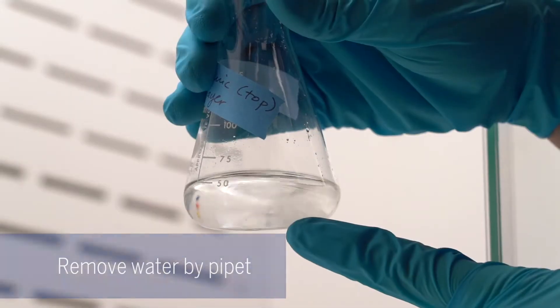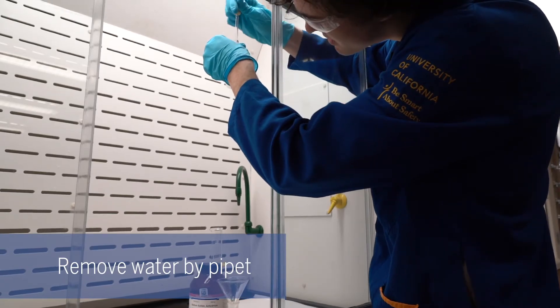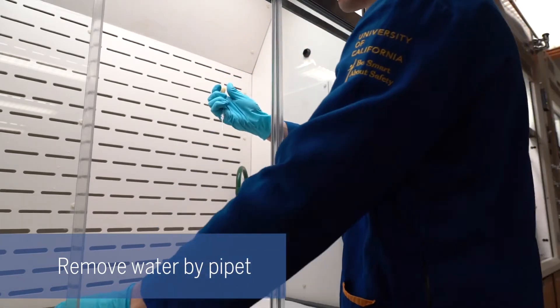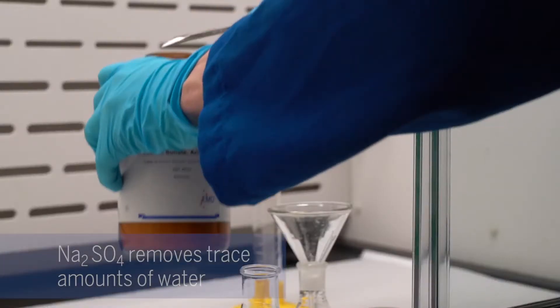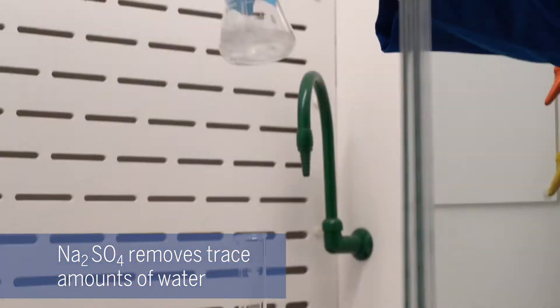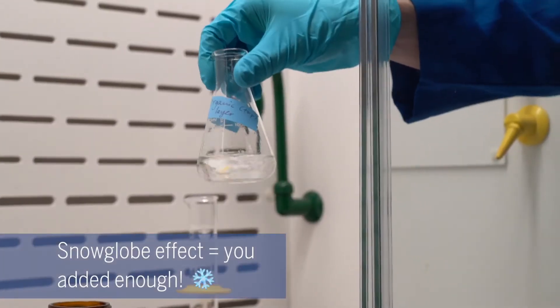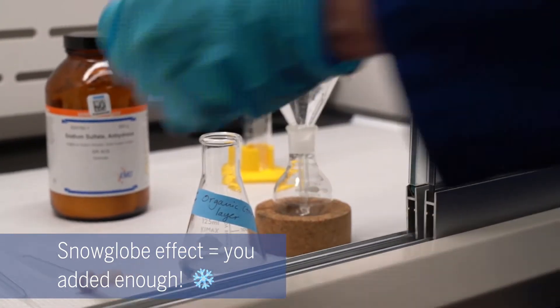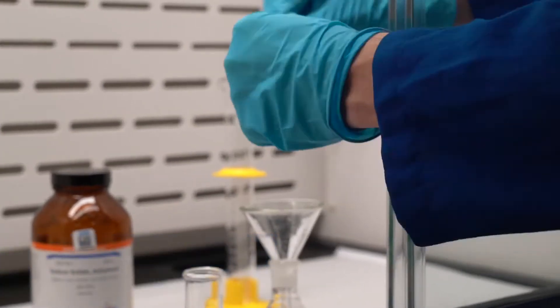By tilting it on its side you can check to see if there's water in there. We can get the residual water by drying it with sodium sulfate. I'm just going to take a spatula and give it a swirl. If you can see the sodium sulfate freely moving around in solution kind of like a snow globe, that means that you've put enough.